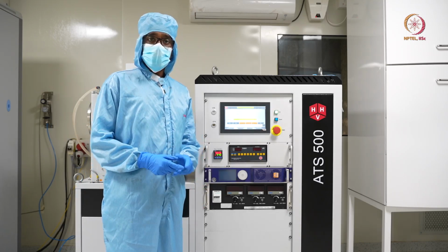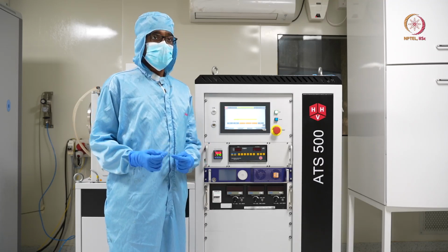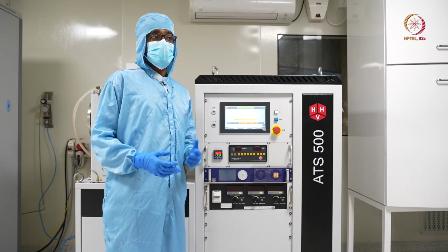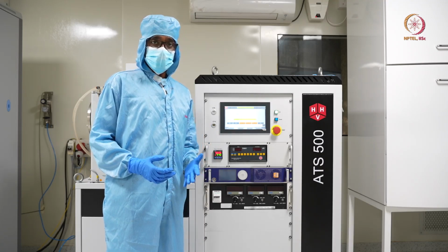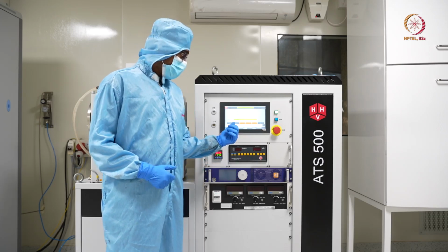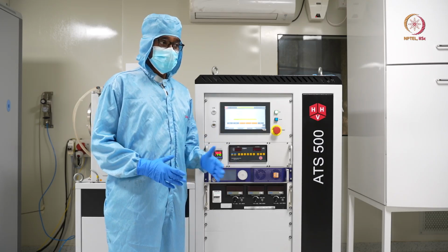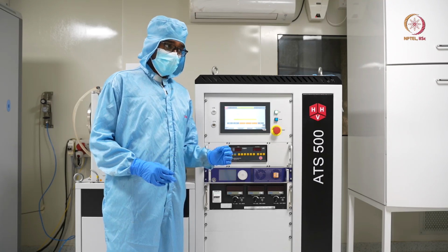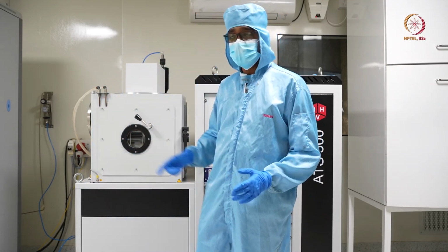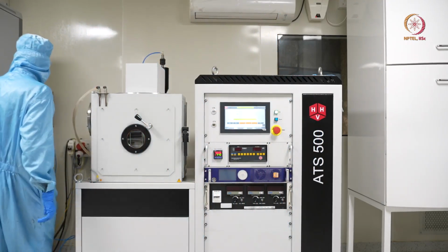So argon supply will help to generate the plasma, and argon, being a little heavier than other gases and being one of the inert gases, will not create any issue. It will not react with either the target or the substrate. That is why we are using argon here. So let me switch on that argon supply first, the one we have shown in the introductory module. We will just switch it on and come.